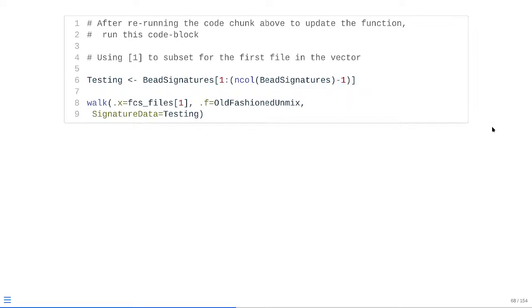we just go to an immediate hard stop, and we're going to get this little error printed to our console window. At that point, we need to double check to see if this works. Rather than try to bring in a mismatched file just to do this test, we're going to use base R, take our existing bead signatures data frame, and drop the very last column. As you can see, this is grabbing from the first to the last column, but -1. So it's just going to grab the first 404 columns. I'm going to pass that in, and then we're going to have a mismatch.